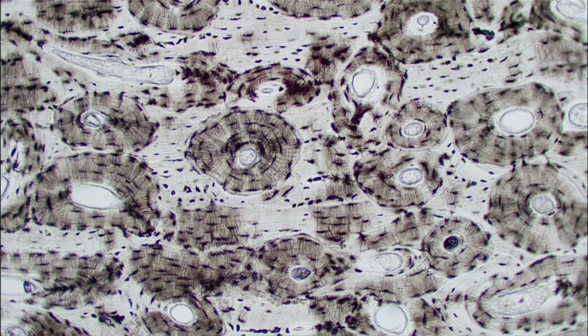Next, we have bone. Everyone loves bone. It is just super easy to work with here. But what we're really looking at are going to be all of these osteons right here. And you'll get in more of this with your upcoming bone exam. You'll have to identify the parts of this. But right now, just focus on knowing that this is bone.